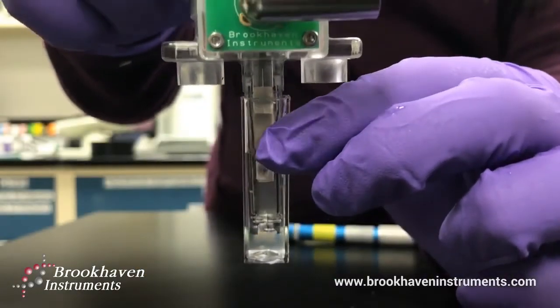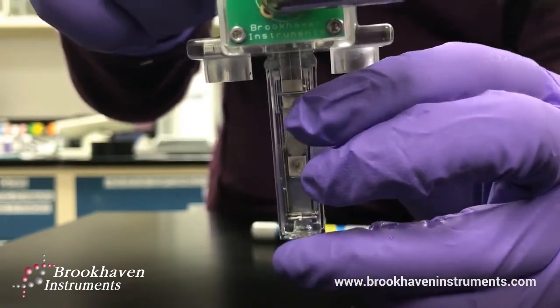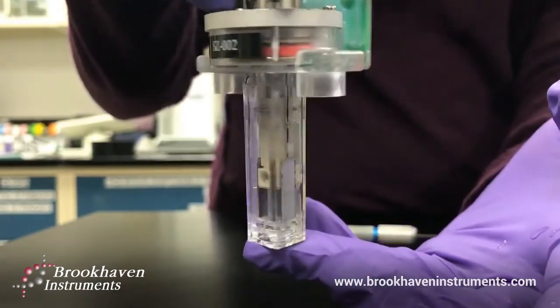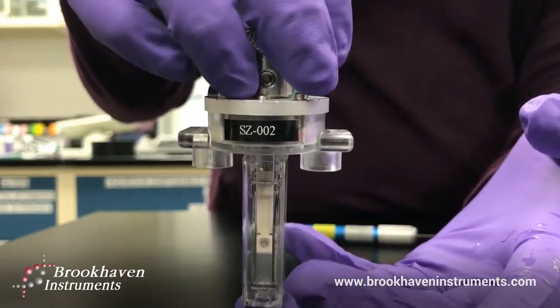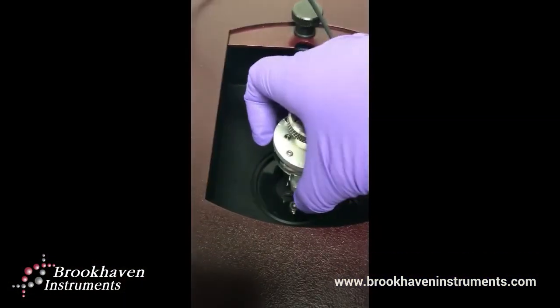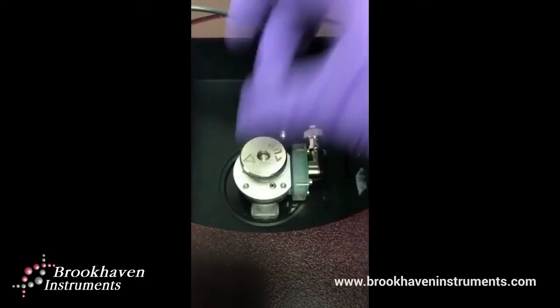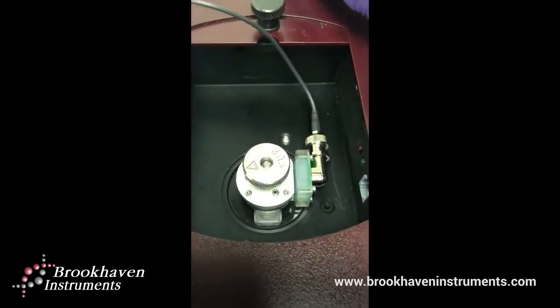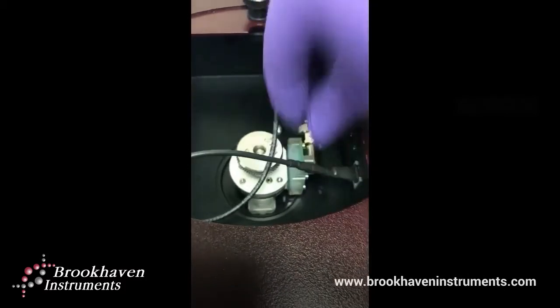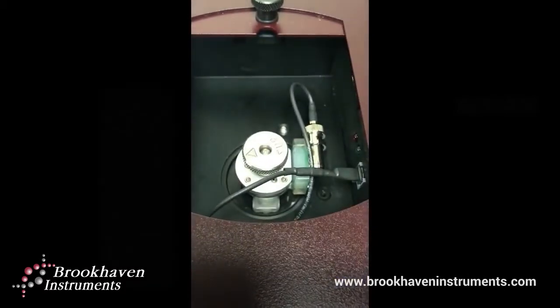This sample is a positively charged membrane, so I will submerge the electrode assembly in a positively charged probe particle solution, making sure there are no bubbles. Now we are ready for measurement. We can insert the assembly into the NanoBrook Omni, making sure that the side wings are firmly secured over the screws inside the instrument.